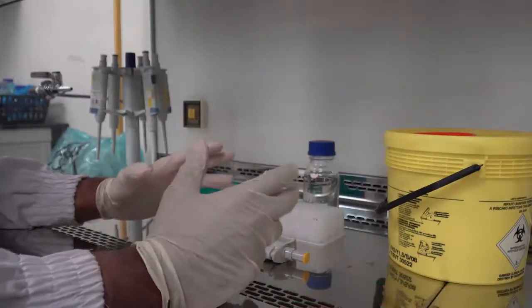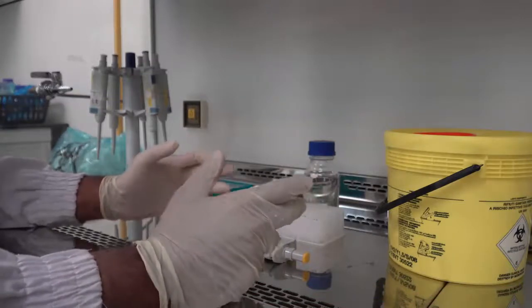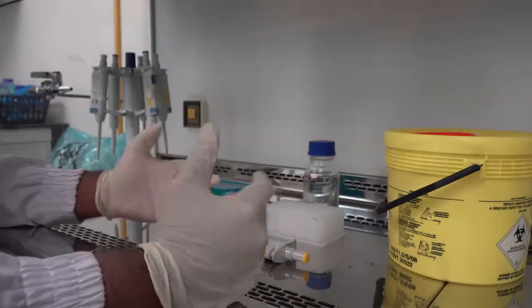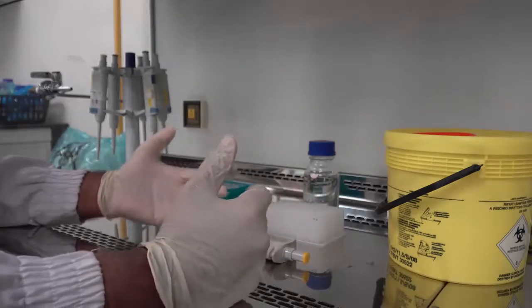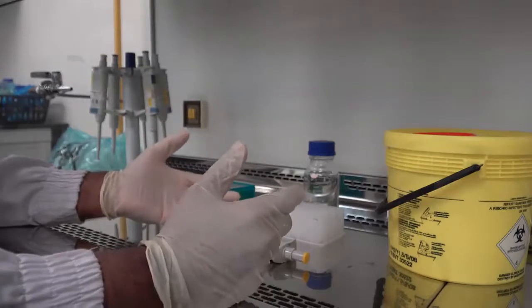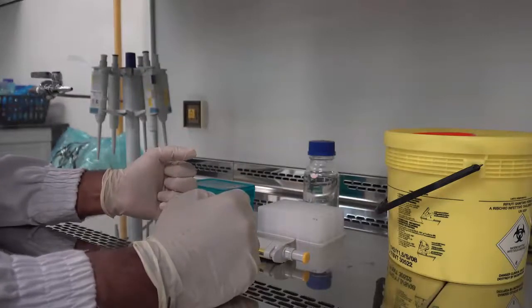These are some of the basic guidelines for utilizing a biological safety cabinet. Please refer to your own specific national and local guidelines when you need to develop your own standard operating procedures for biological safety cabinets. Thank you very much for watching.